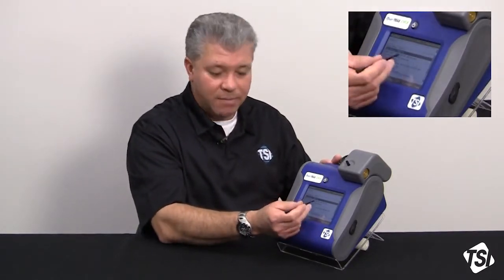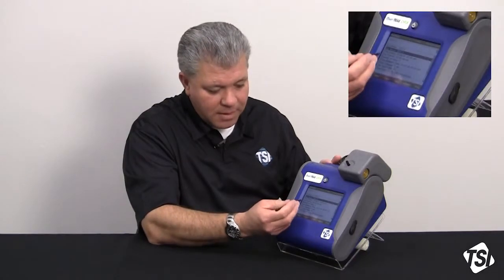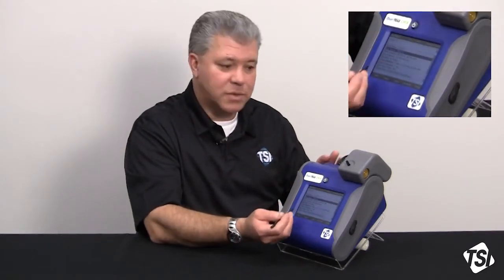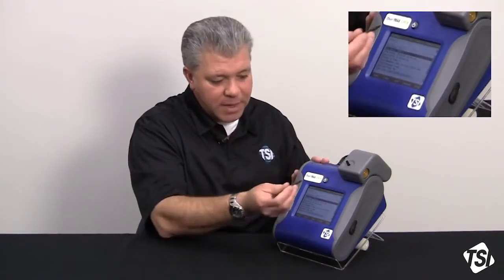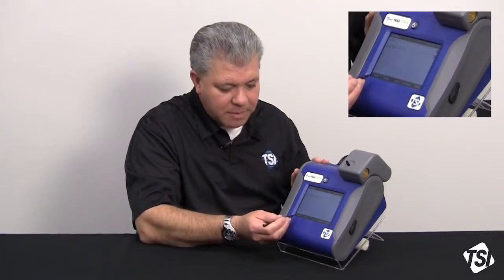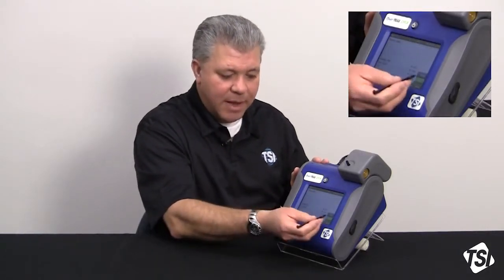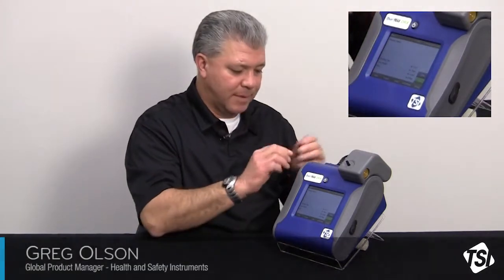I can reset, if I need to, my log interval, but again, that's no less than 2 minutes. It could be 2 minutes, it could be as great as 1 hour. I can set all my other parameters. How many samples do I want to take? Do I want it to be a continuous run? And so on and so forth. Once I get all of this programmed, I simply hit main, go back to the main screen, and I'm ready to start sampling.